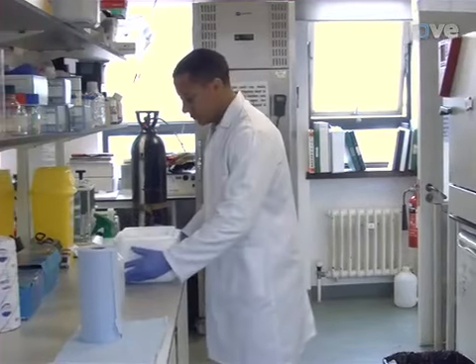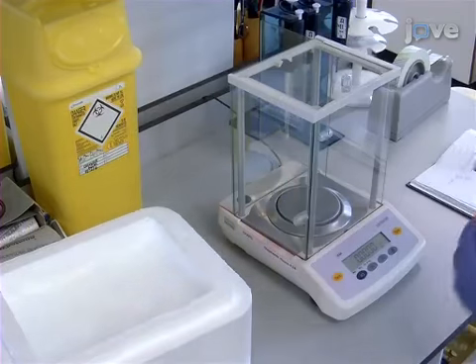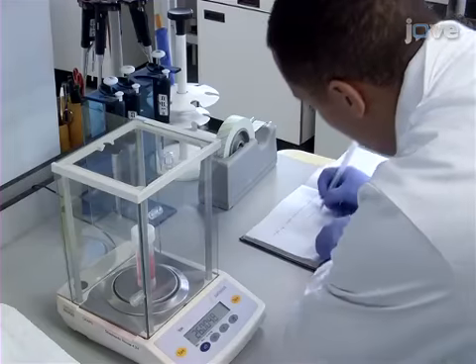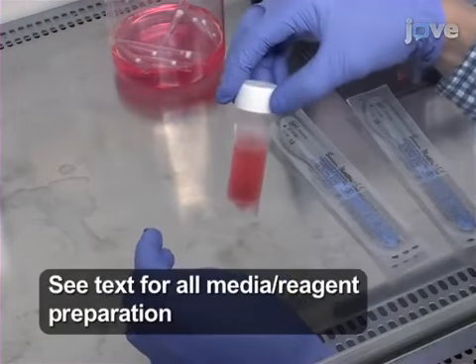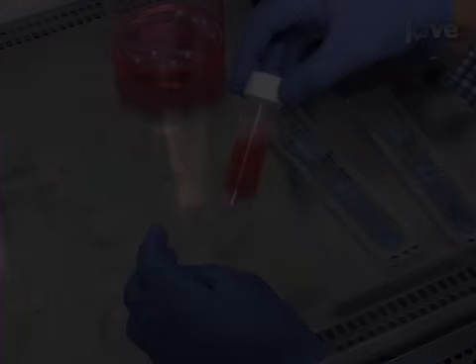To isolate the muscle-derived precursor cells, as soon as possible after obtaining the biopsy, first determine the weight of the tissue sample, and then wash the muscle in basal medium several times to wash the sample clear of excess blood. Let the muscle sediment at room temperature.